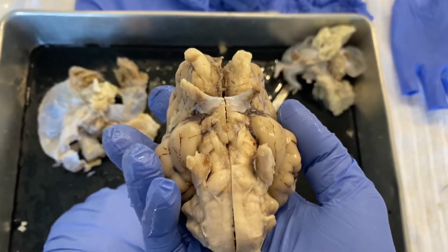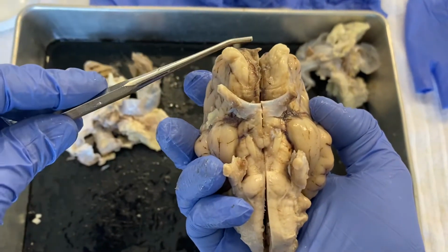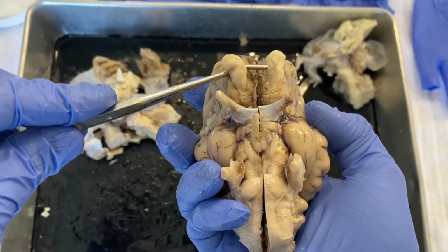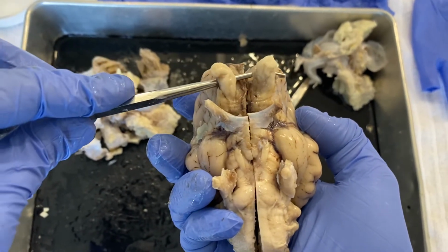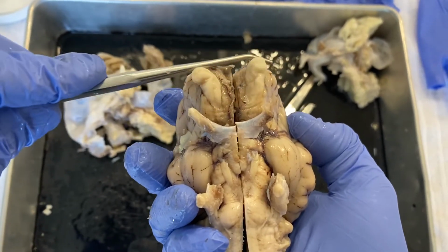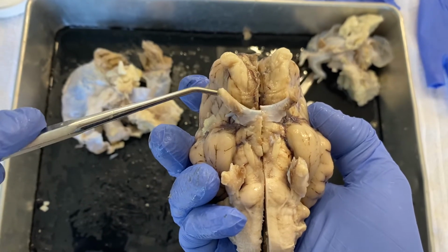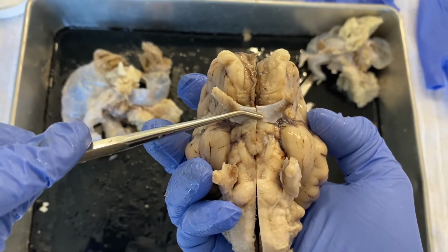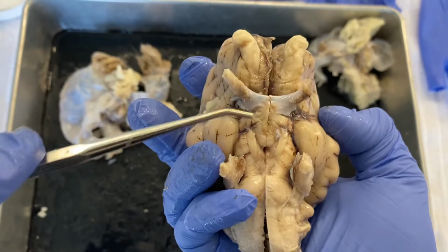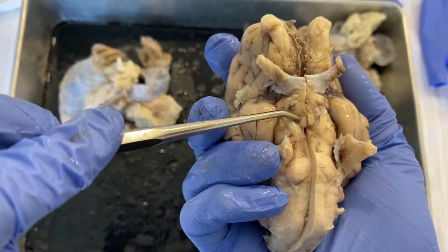Okay, we are going to look at this brain one more time in the dissections that I made. So just to reiterate, we have here what are called the olfactory bulbs. These, of course, are cranial nerve number 1. Here's cranial nerve number 2, the optic nerve, leading down into the optic chiasm. Inferior to that are the mammillary bodies, which are here.